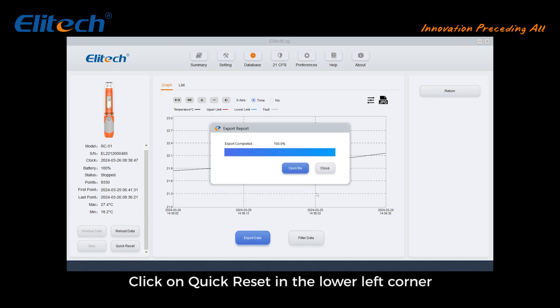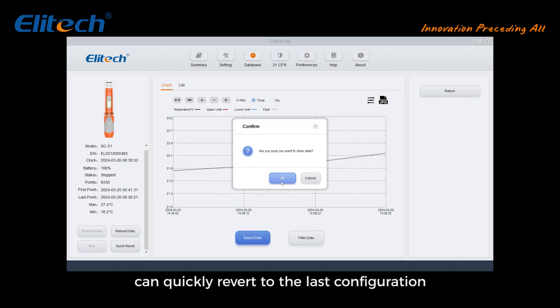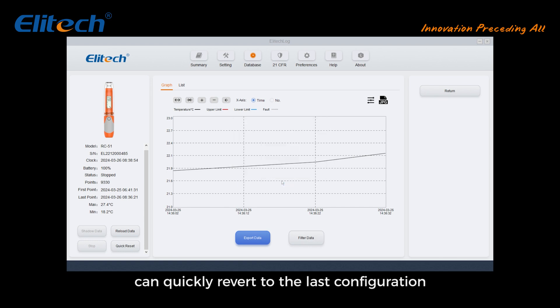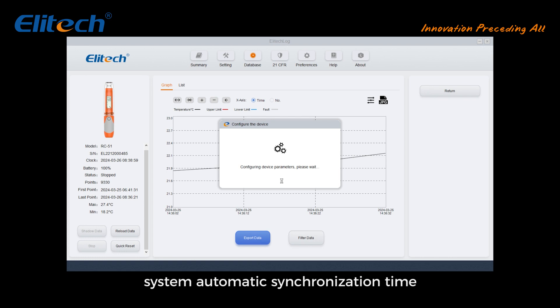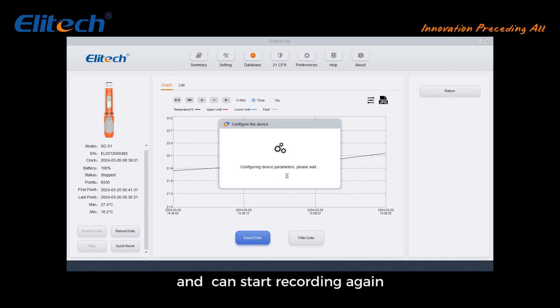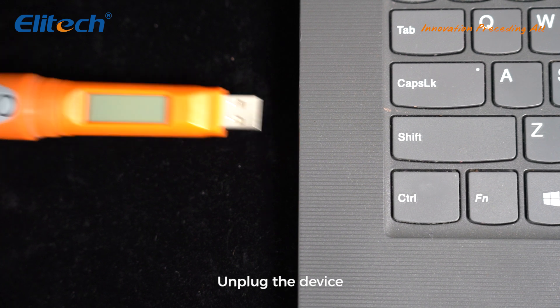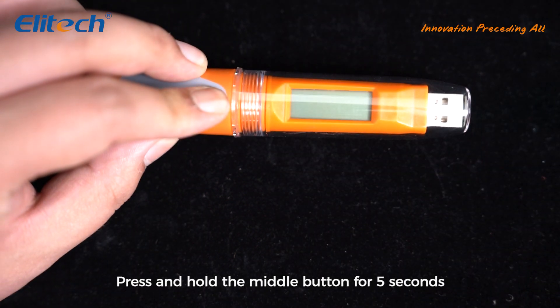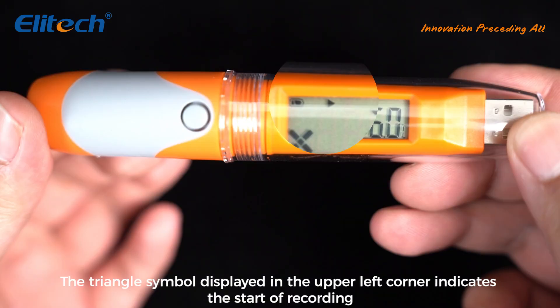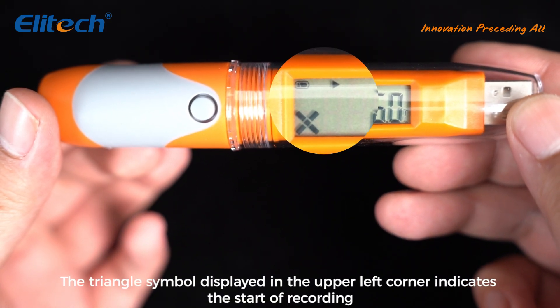After making a backup, click Quick Reset in the lower left corner to quickly revert to the last configuration. This will simultaneously format the data and automatically synchronize the time, after which you can start recording again. Unplug the device, press and hold the middle button for five seconds, and the triangle symbol displayed in the upper left corner indicates the start of recording.